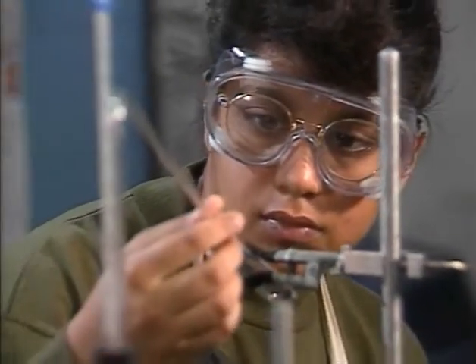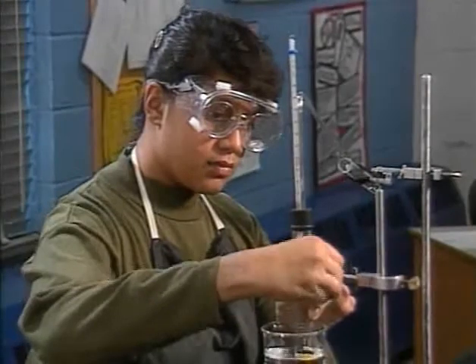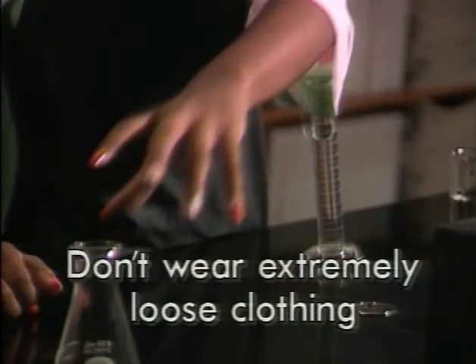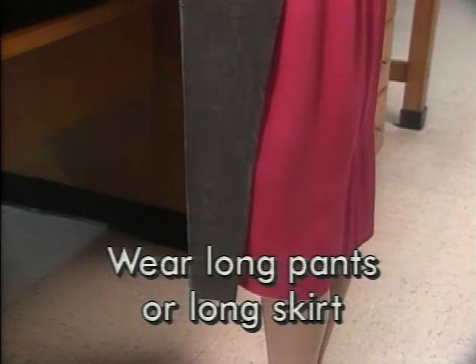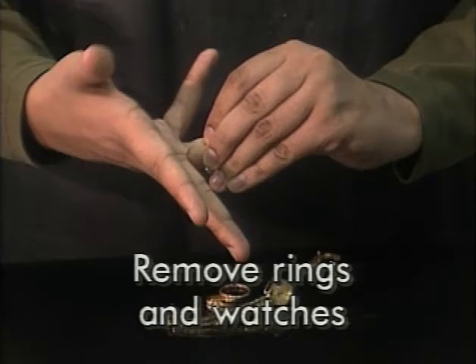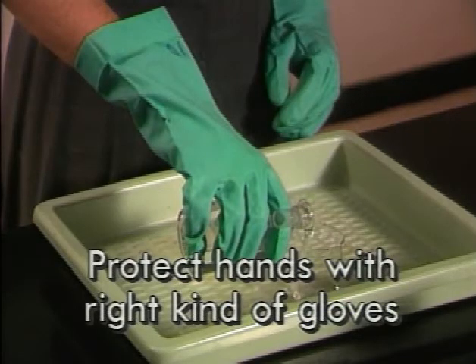Clothing safety summary: don't wear extremely loose clothing; fabrics should be sturdy and natural; wear older clothes and cover them with a lab apron; wear long pants or a long skirt to cover your legs; wear closed leather shoes to protect your feet; tie up long hair; remove rings and watches; take out contact lenses; cover your eyes with goggles with side shields; protect your hands with the right kind of gloves.